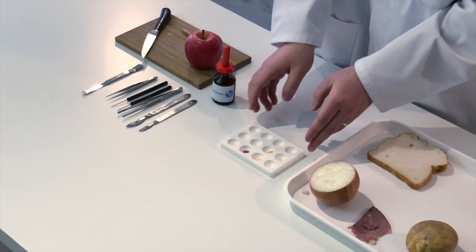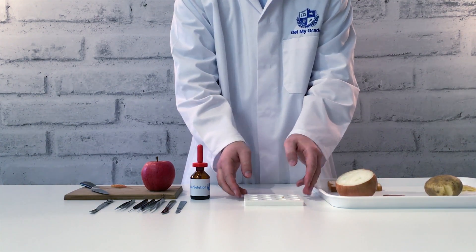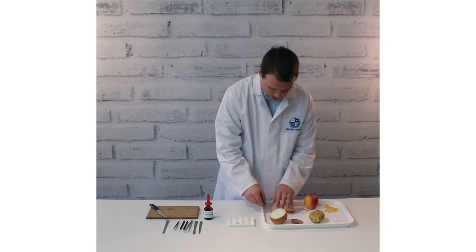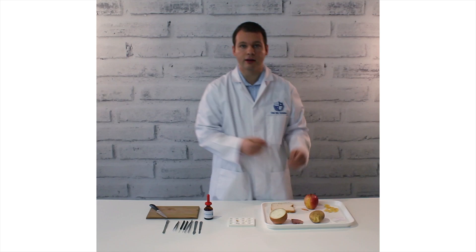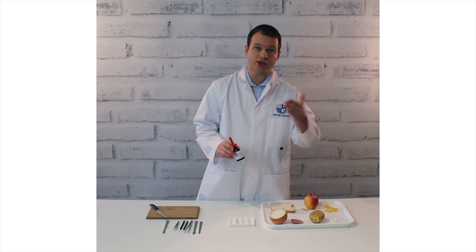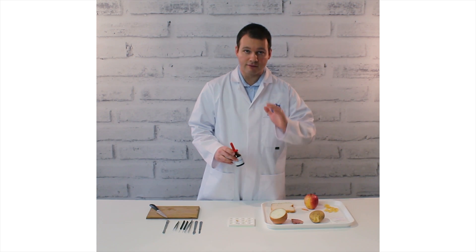Notice we're only really using very, very small samples here. You don't need large amounts at all. And then a small piece of bread. And now we're ready to go. You'll see the results instantly. Very, very quick, very, very straightforward.